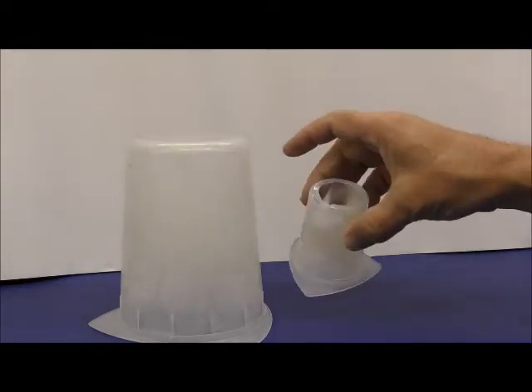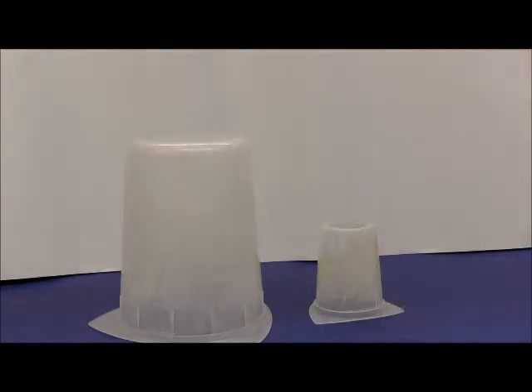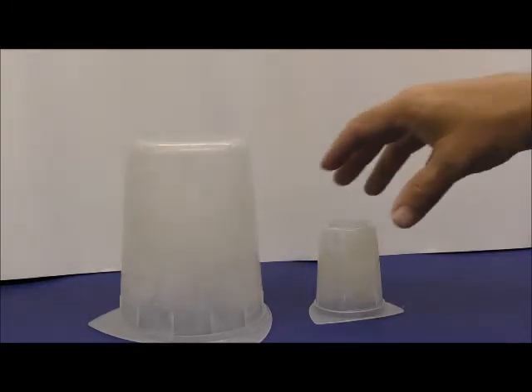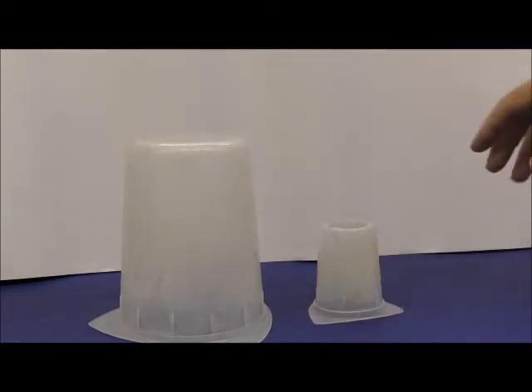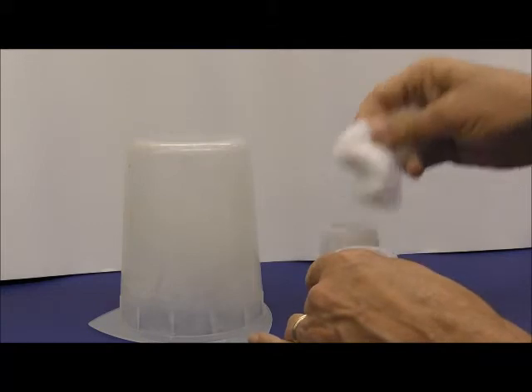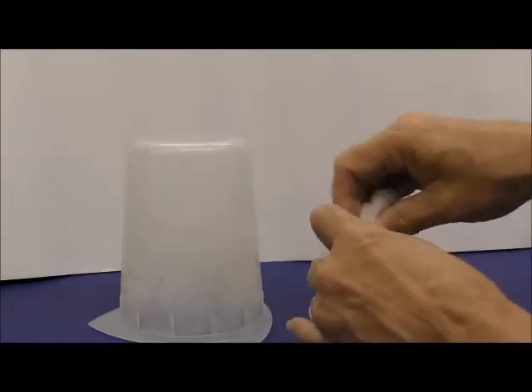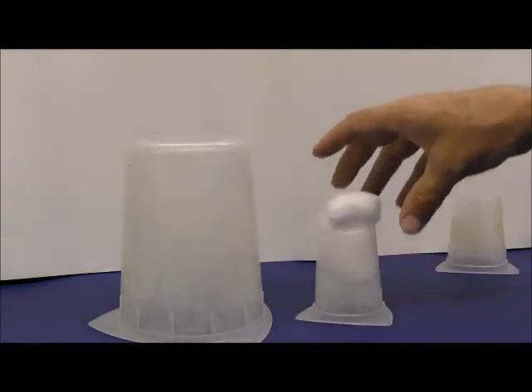Then once you have a hole made in these, one can use cotton or something to cover this. So what we've done here is make a hole in this one, and a cotton plug can fit in there. You have to get the jumbo cotton to make that work.